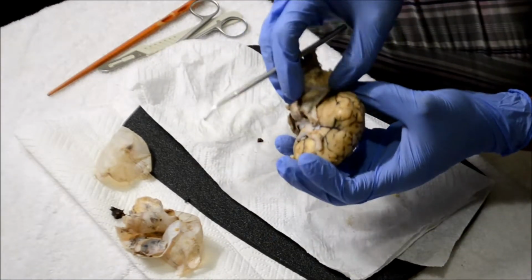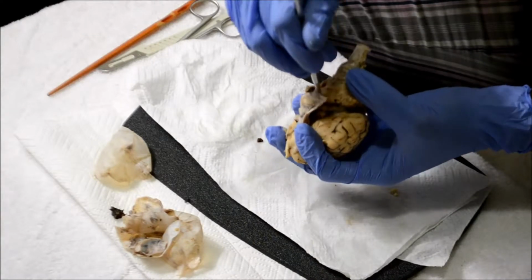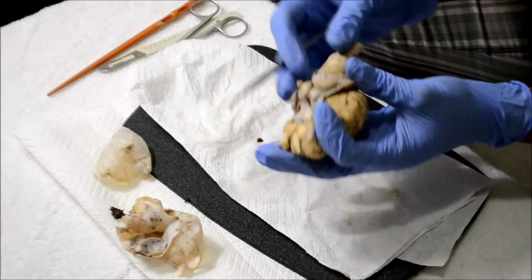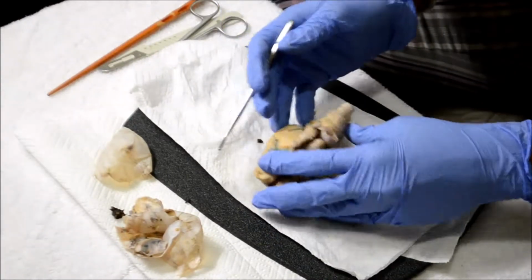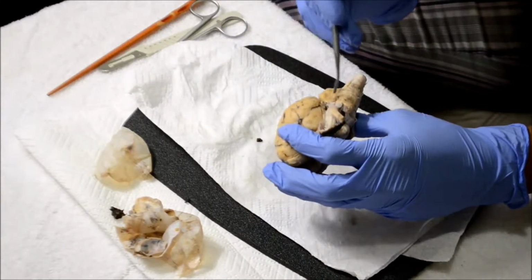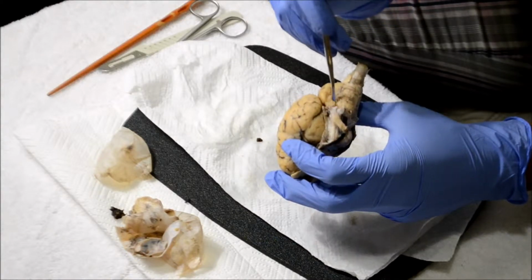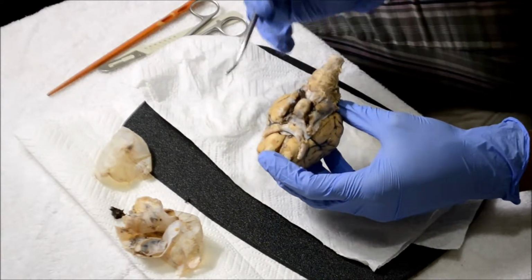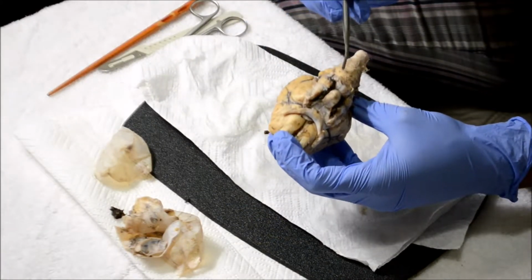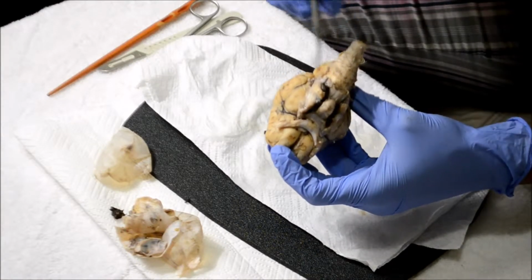Then the trochlear nerve, nerve number 4. Pretty hard to see, I was able to find it. It is underneath right here, the trochlear nerve. Then the trigeminal nerve, nerve 5, which is difficult. We can't really see it, but it should be somewhere in this region right there. Next is the abducens, which should be as well difficult to see, but it should be right here, abducens.